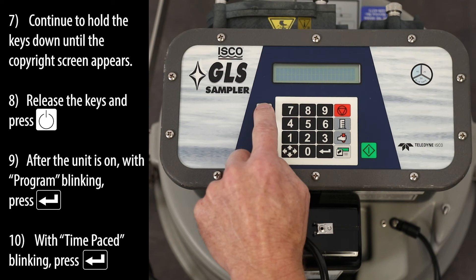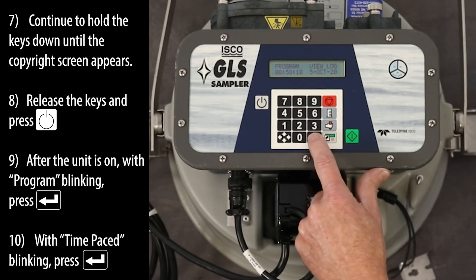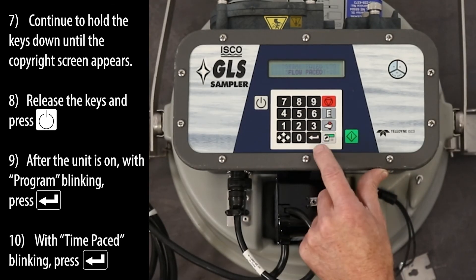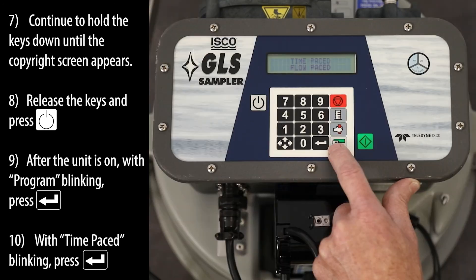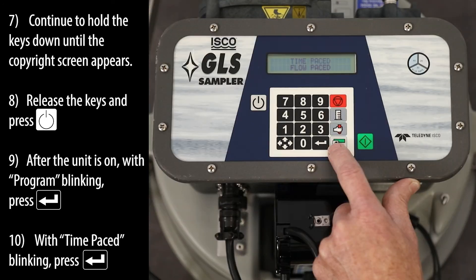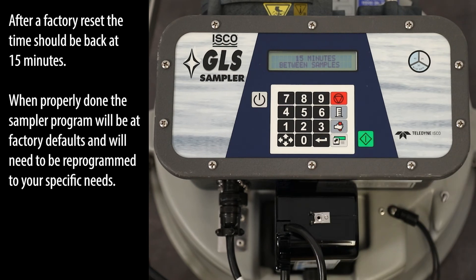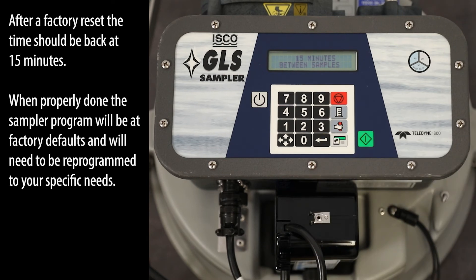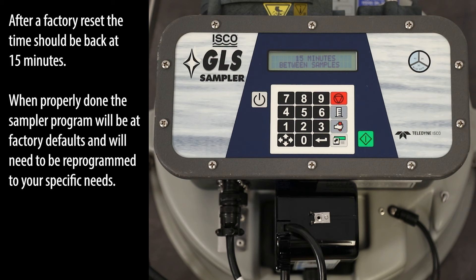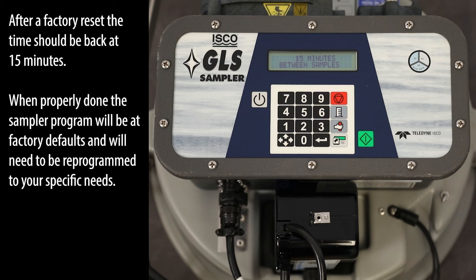Release the keys and press the On key. After the unit is on, with program blinking, press the Enter key. With time pace blinking, press the Enter key. After a factory reset, the time should be back at 15 minutes. When properly done, the sampler program will be at factory defaults and will need to be reprogrammed to your specific needs.